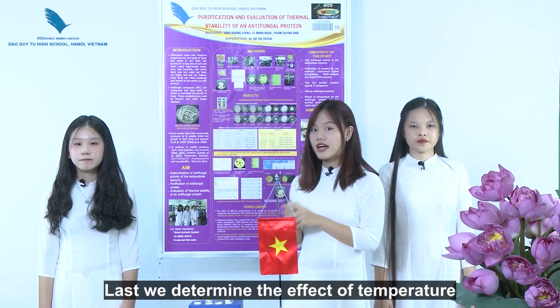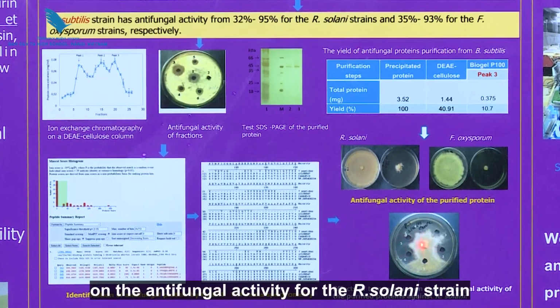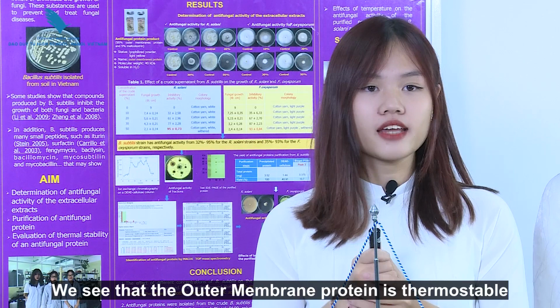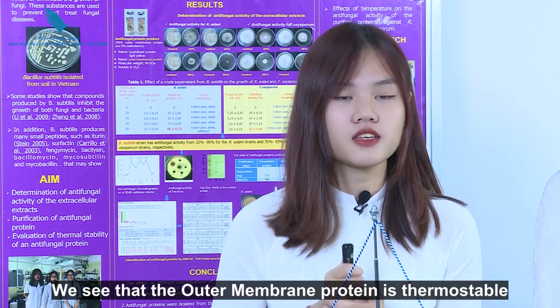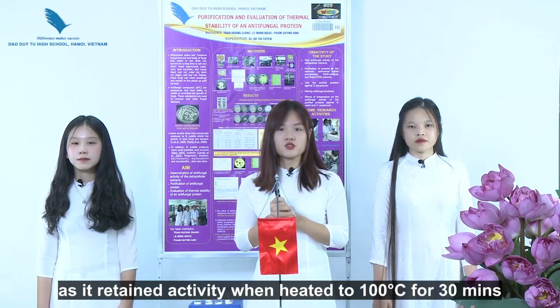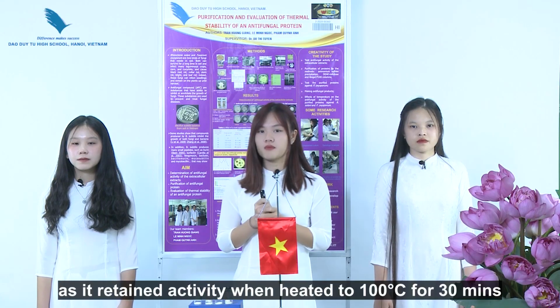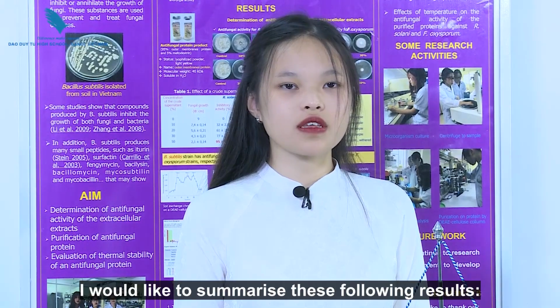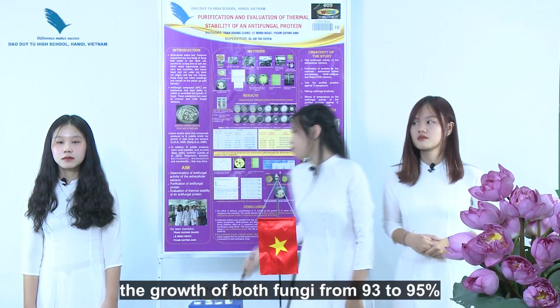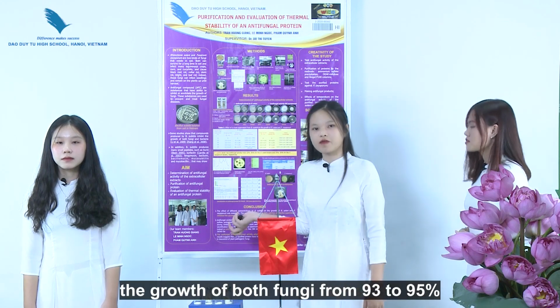Last, we determined the effect of temperature on the antifungal activity for the Rhizoctonia solani strain, and we see that the outer membrane protein is thermostable as it retained its activity when heated to 100 degrees for 30 minutes. I would like to summarize the following results. First, 50% Bacillus supernatant inhibited the growth of both fungi from 93 to 95%.